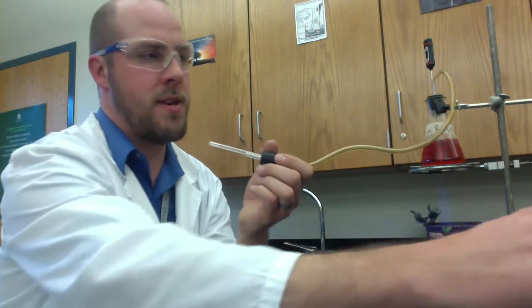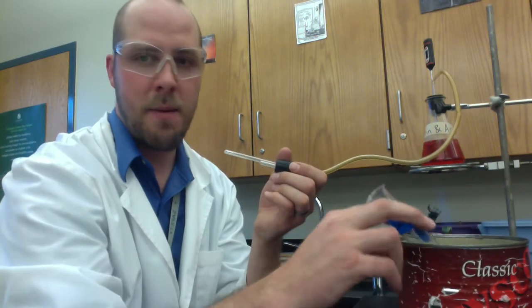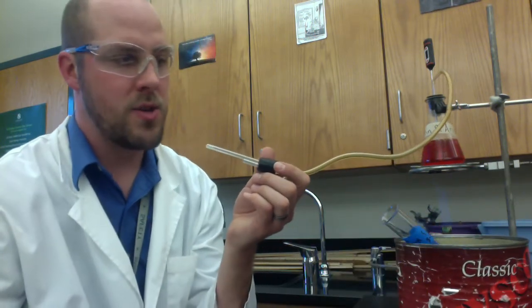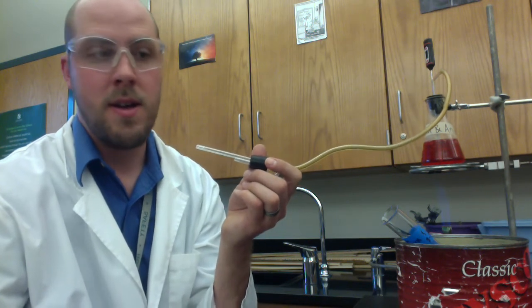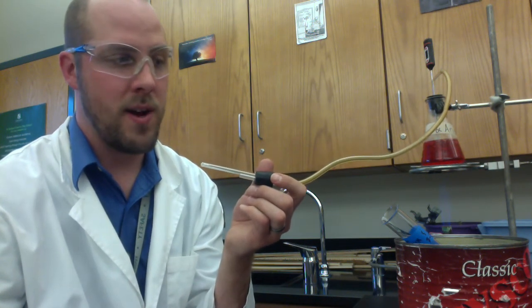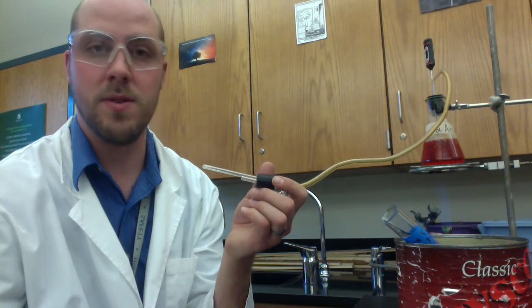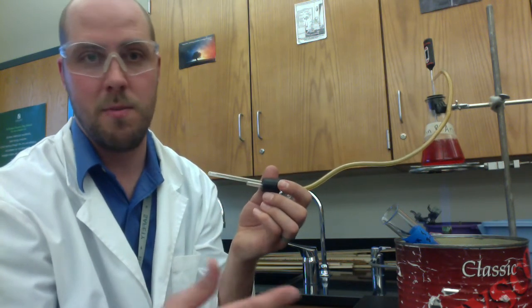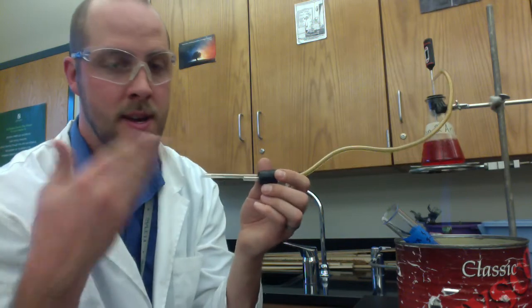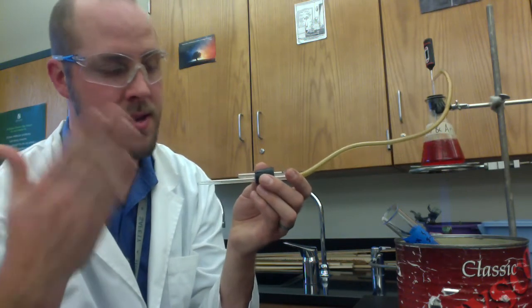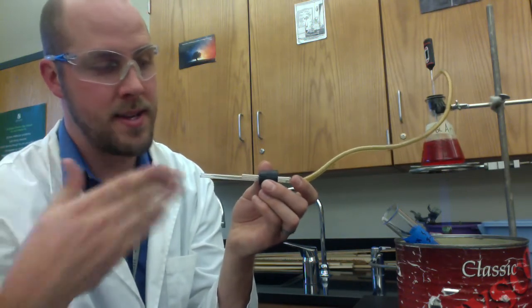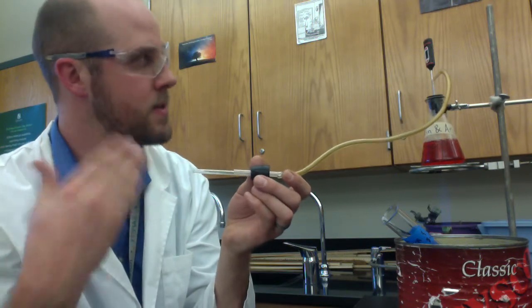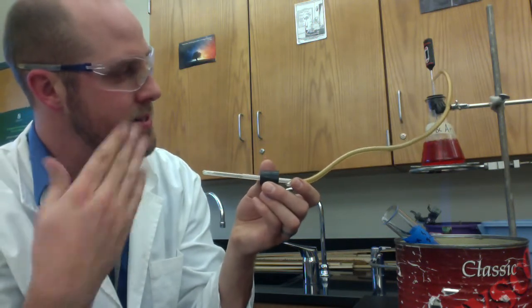So once again you are wafting and this will take us kind of a while so I'm going to keep on talking as we are wafting. A couple of things you should be aware of as well. We've got our ice bath over here and compared to our soda can crush you actually want a lot of ice in here and you're going to have to monitor the amount of ice because we are using ice to kind of continuously condense and cool our reaction. So you might have to at some point send your partner up or you go up and get some more ice to replace the ice that has melted in the course of this experiment. I'm at 28.6 degrees Celsius now.